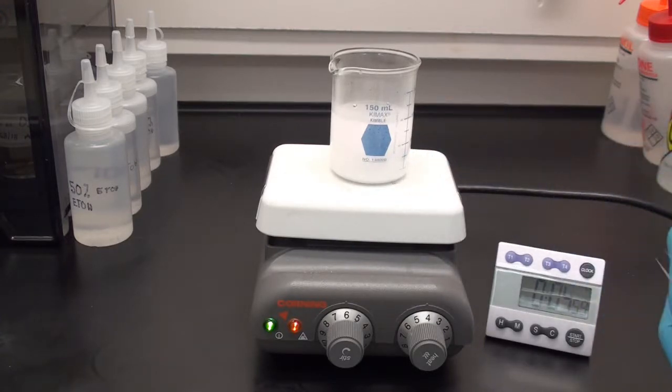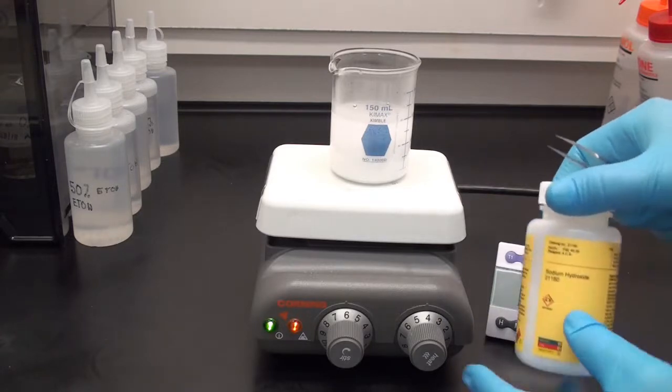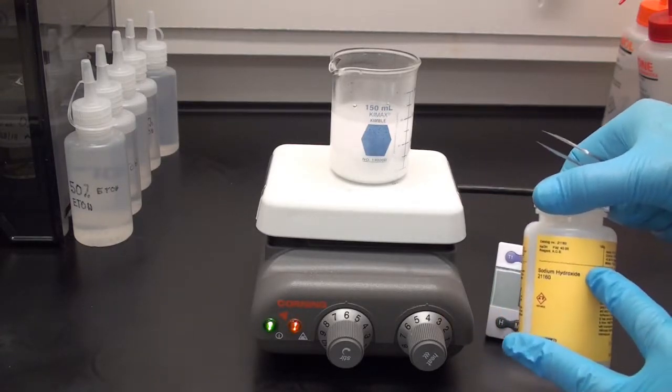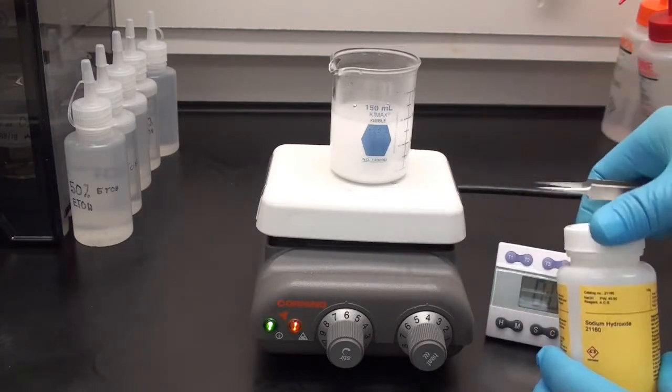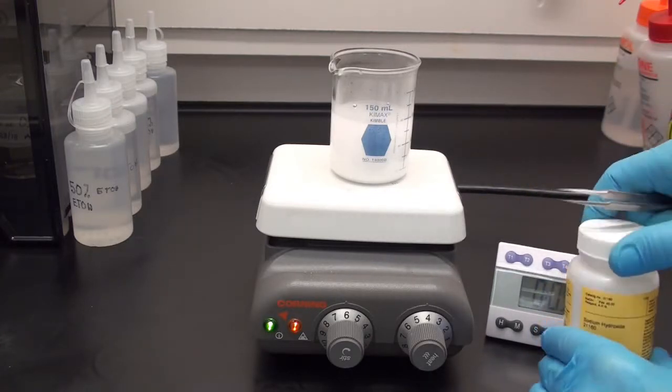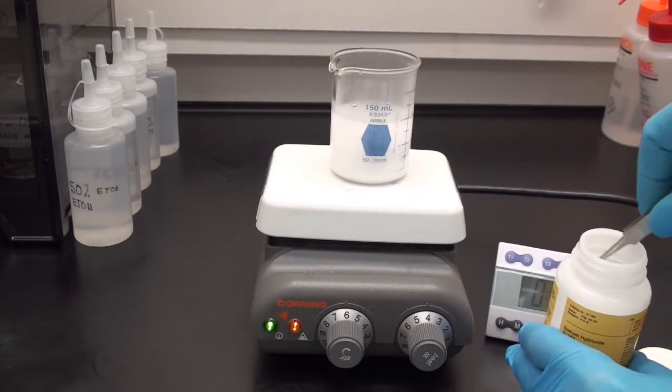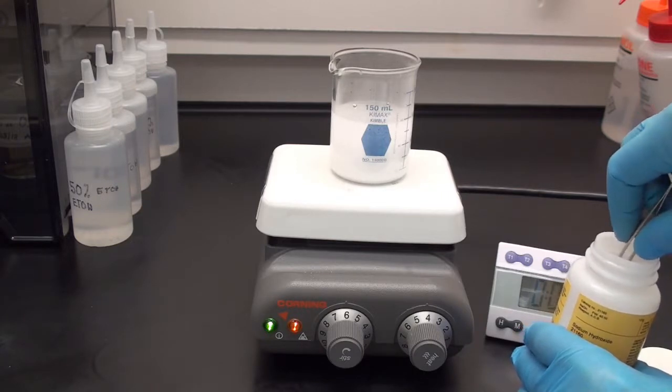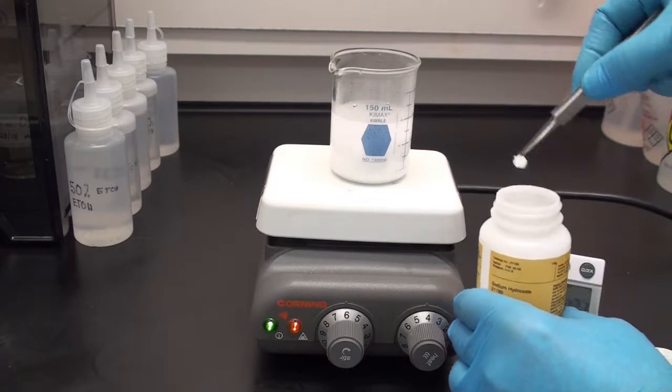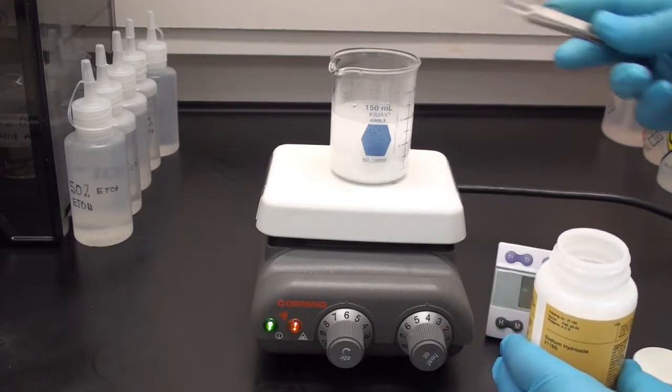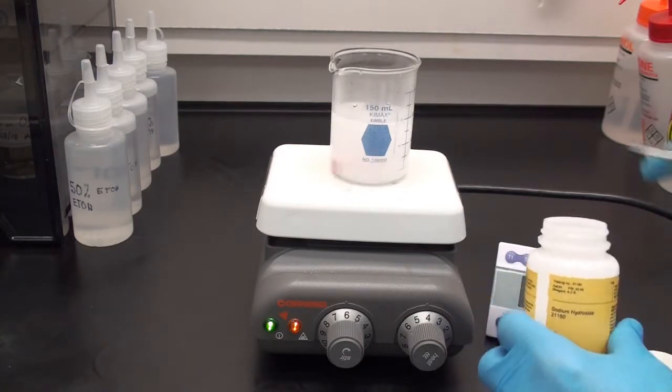I'm going to let that mix for about 3 to 4 minutes. In order to clear this so it goes into solution, I have to put in sodium hydroxide. It requires a strong base solution in order to go into solution. So I'm going to put in one pellet of sodium hydroxide first and see how that goes. You don't want to overdo things. It will start to clear a little bit as the sodium hydroxide goes into solution.